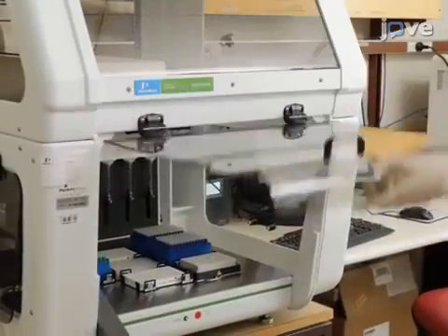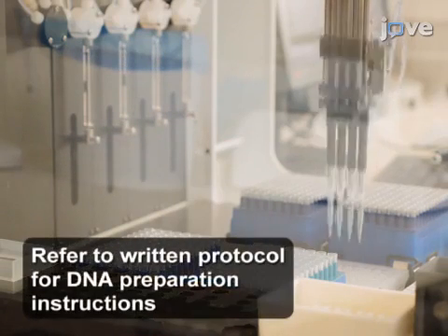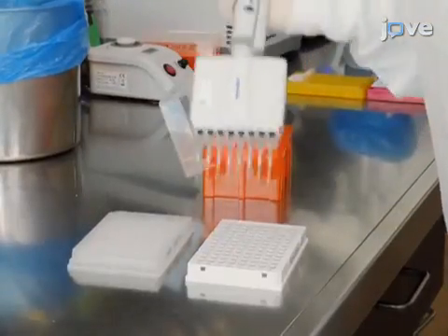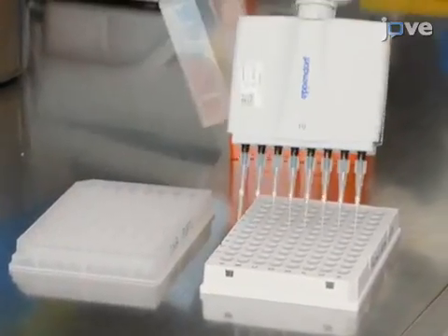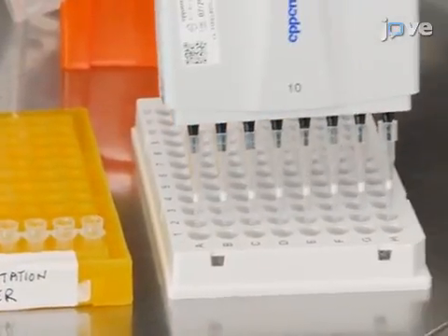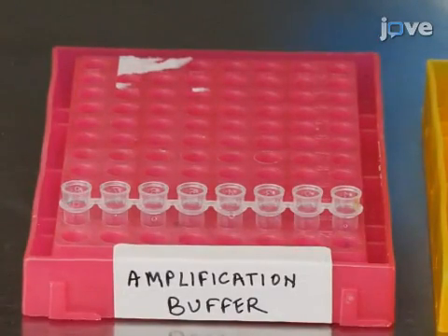To begin, prepare genomic DNA samples from clinical and commercial strains of Candida glabrata. Then, add 5 microliters of quantified DNA to each well of previously labeled fresh 96 well, hard shell, thin wall plate. Add 10 microliters of tagmentation buffer and 5 microliters of amplification buffer to each well.